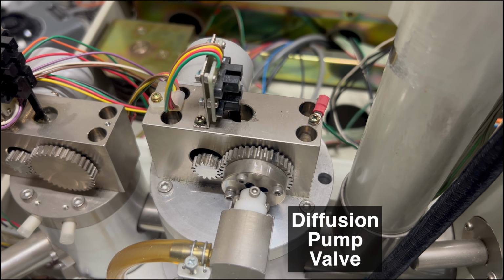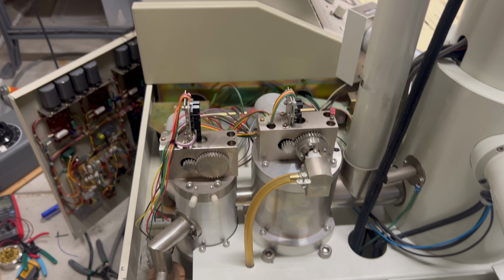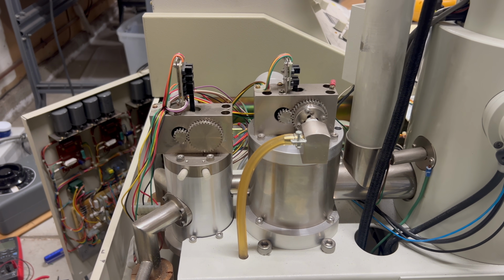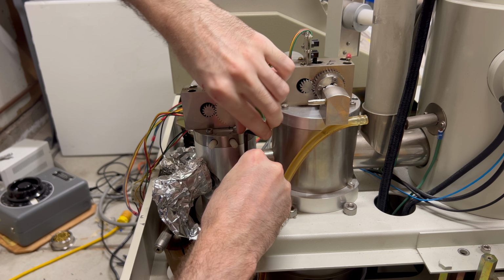But wait. Oh no, we've got a problem. The second valve is stuck and won't open. Well, honestly, what did I expect? These valves probably haven't been serviced in at least 20 years. Looks like it's time for some much needed lubrication.